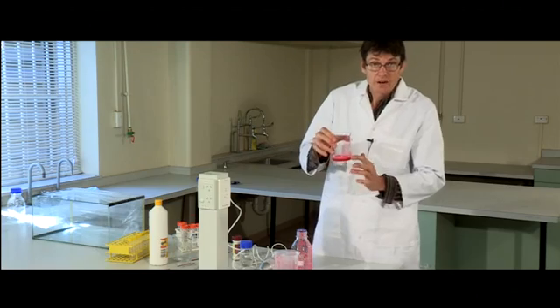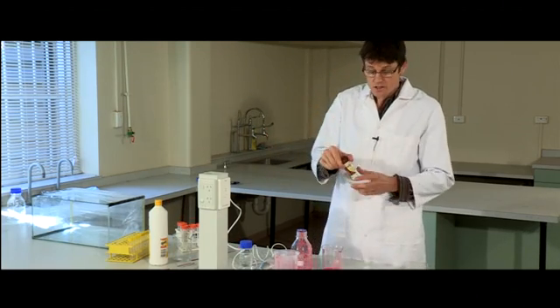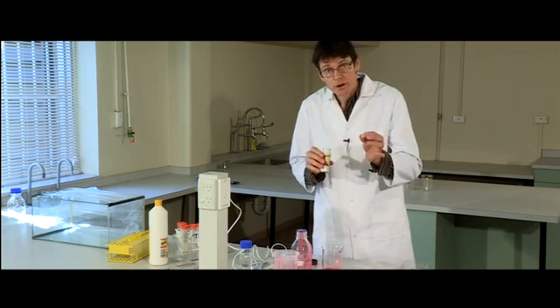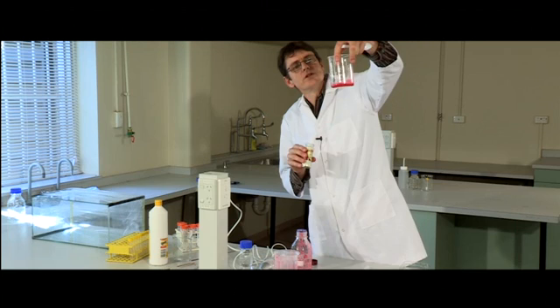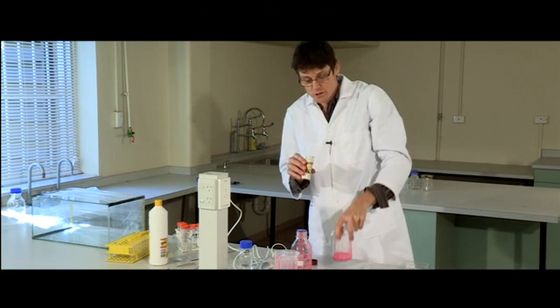Now we have to add our enzyme. Very simple—just meat tenderizer straight from the supermarket. All this does is strip out a few of the proteins that are clinging to the DNA. Now I've only got 40-odd ml of strawberry juice here.